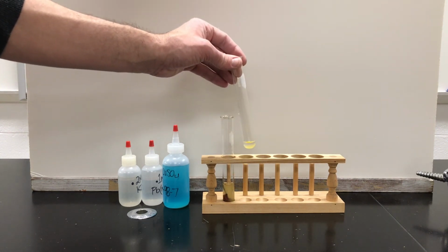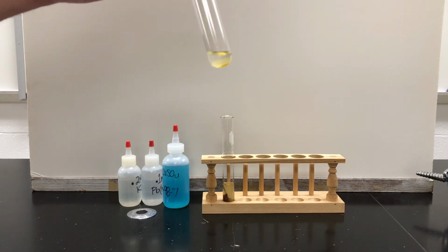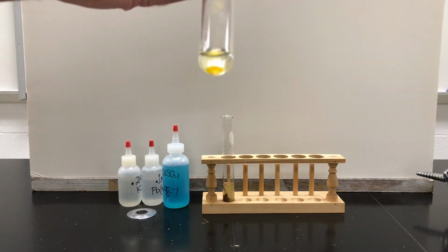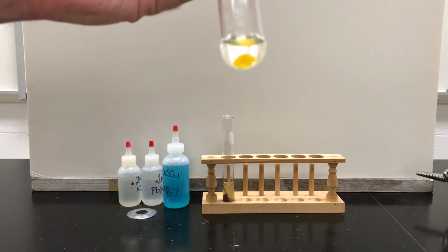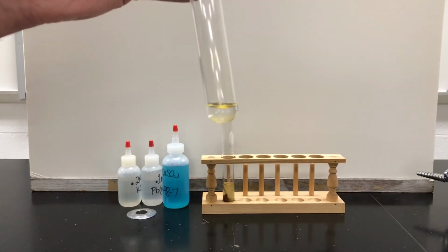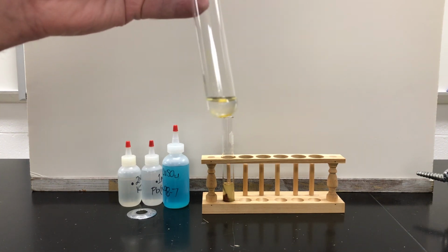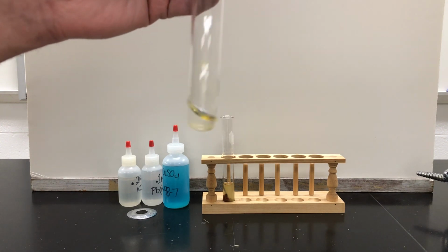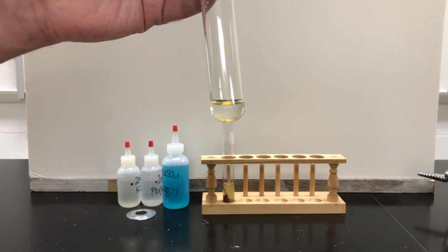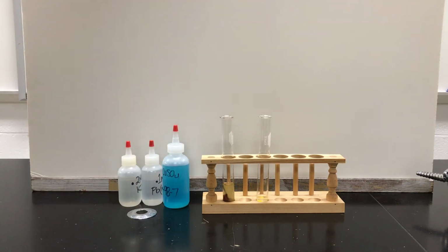The other chemical reaction we did yesterday was potassium iodide and lead nitrate. And as I told you, all that precipitate would fall to the bottom of the test tube, and it has. All that yellow solid. And you'll note the rest of the liquid is clear because that precipitate goes to the bottom. So when we mixed this, that yellow stuff is lead iodide. Lead iodide has formed. That means there's potassium and nitrate now floating around in that water. We'll talk more about that with our data sheets, and like I said, we're going to continue with other chemical reactions as we move forward in the course.